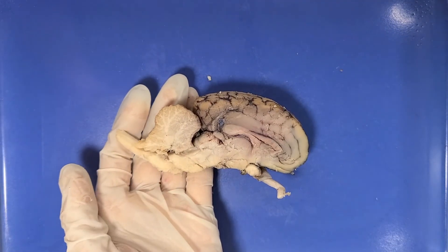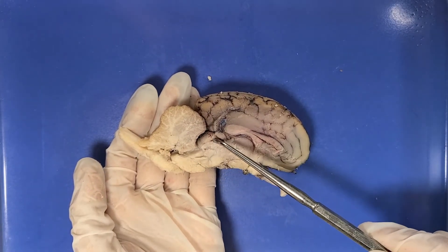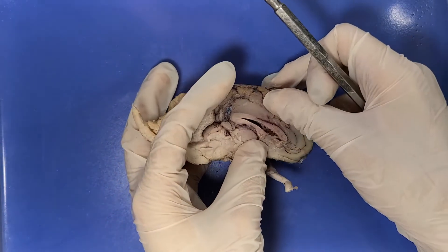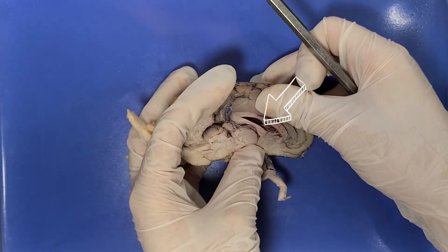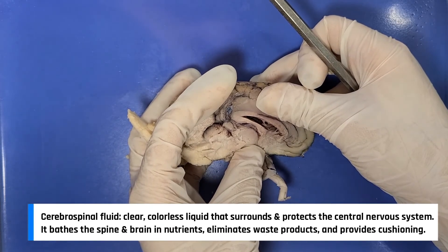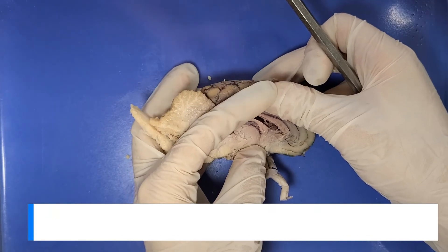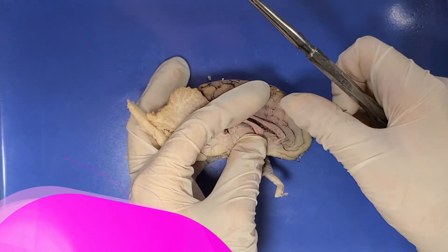You can see parts of the brain stem again — the medulla, pons, and the midbrain right here. Here is the cerebellum. This indentation here is a ventricle. The ventricles are a network of cavities in the brain filled with cerebrospinal fluid. They're responsible for the production, transport, and removal of cerebrospinal fluid, which bathes the brain. This one here is called the lateral ventricle — it is the largest ventricle in the brain.